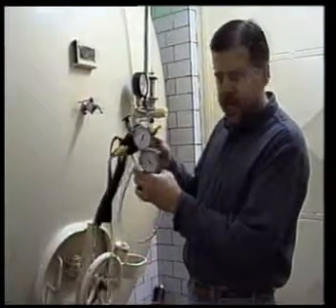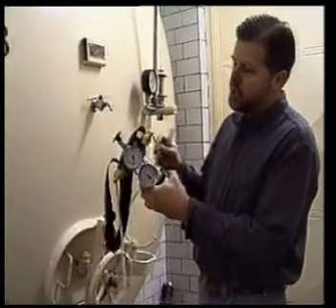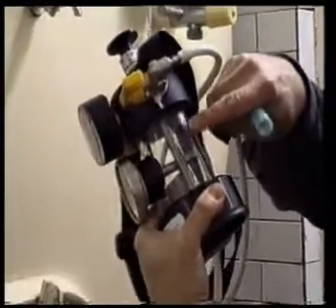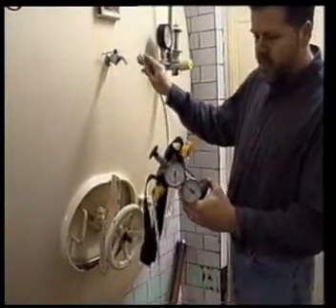To begin using the GMA CO2 testing device, the first step is to attach your hose to the input that is closest to the inlet tube where the beer goes in. You need to have a hose that properly fits your spigot on the tank.